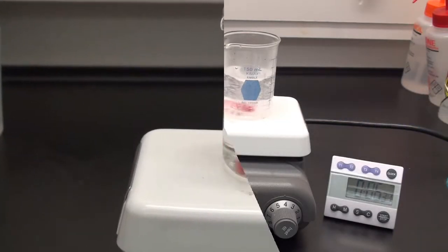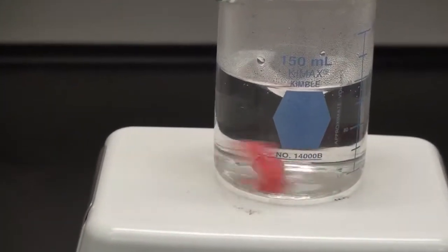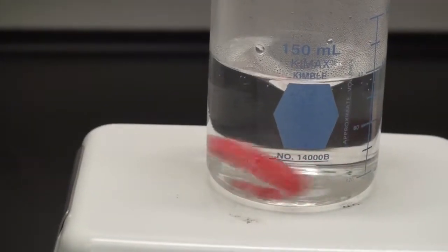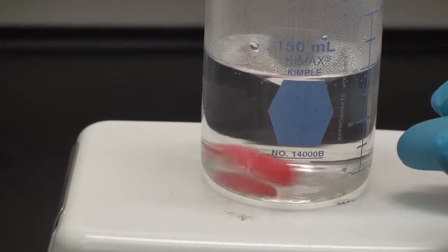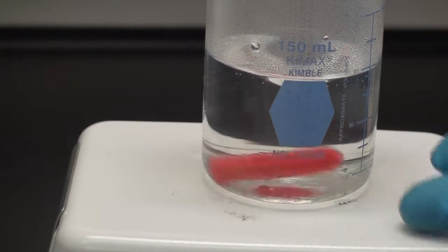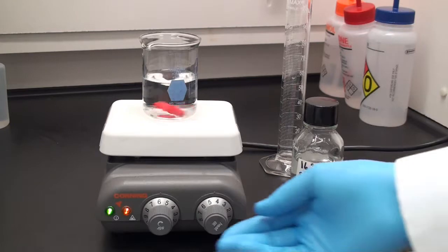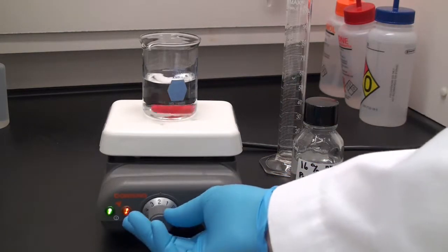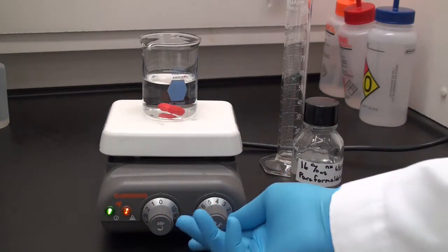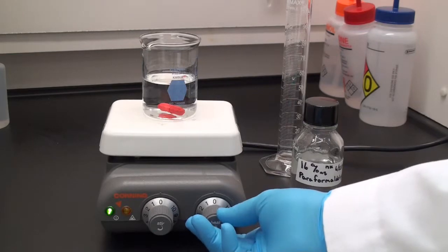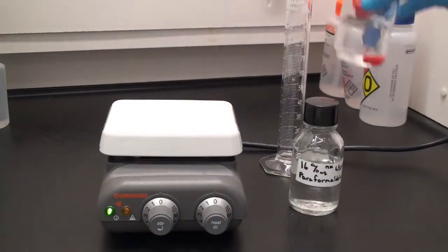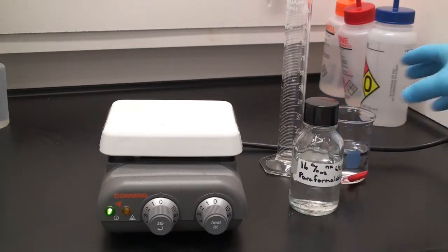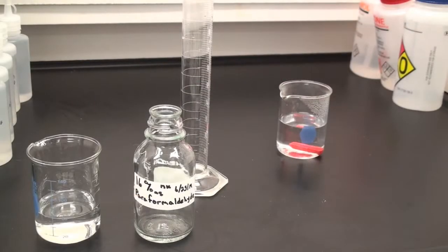We still have some pellets moving around in there. So now after only 9 minutes, the solution is totally clear and is ready to put into my bottle. Of course, you want to turn off your stir bar and reduce the heat and get things out of the way. When you're working with liquefied paraformaldehyde, you don't want to have things spill and get equipment out of the way of the fume hood.